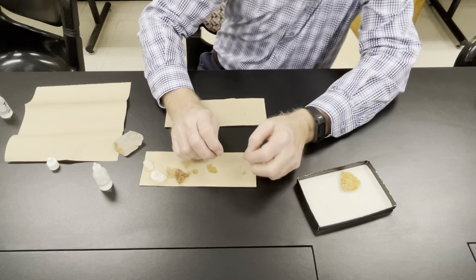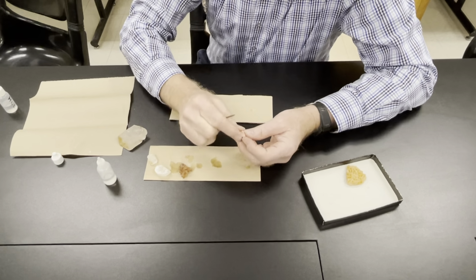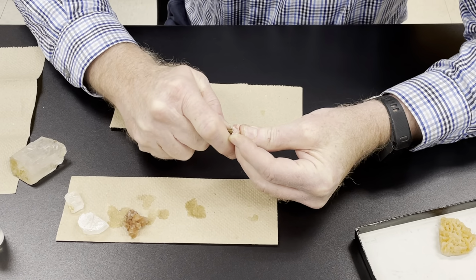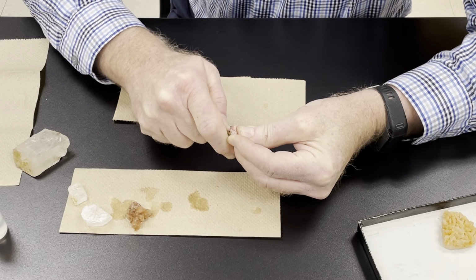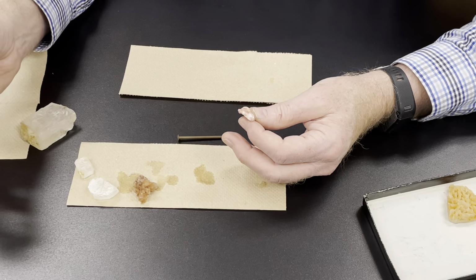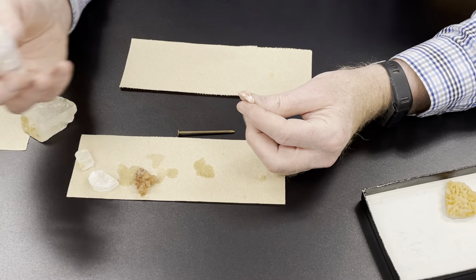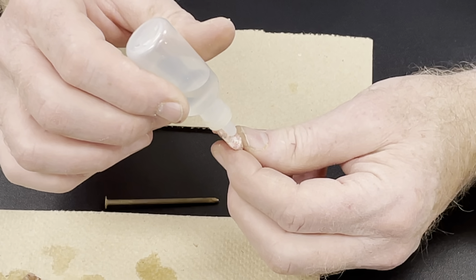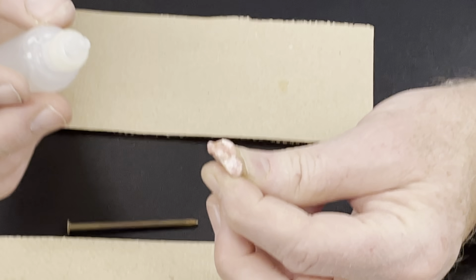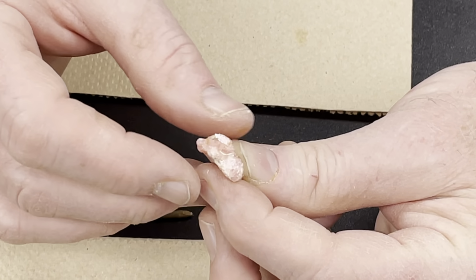So I need, do we have a nail handy? We don't. Yep, in this box. All right, so what we're going to do, I'm going to scratch it. Now what scratching does is it makes a powder on the surface. And the powder is more reactive than the big surface. So the reason I grind my coffee in the morning before I brew it is because it's much more reactive as a fine grind than as big pieces. So I'm going to put that on there, and you can see, oh yeah, there is some effervescence of the powder. So rhodochrosite is one where you can see the reaction more in the powder than you can in the non-powder.